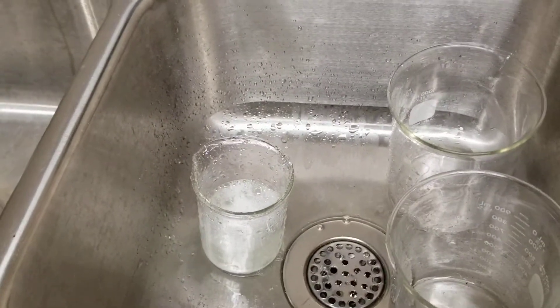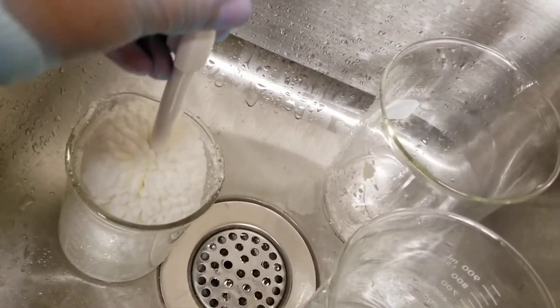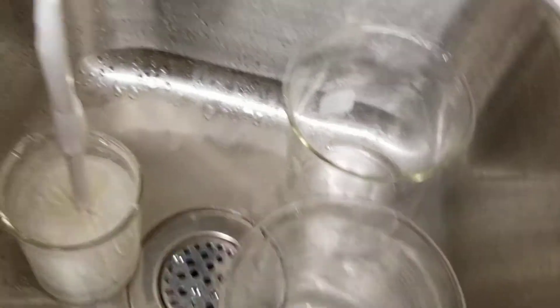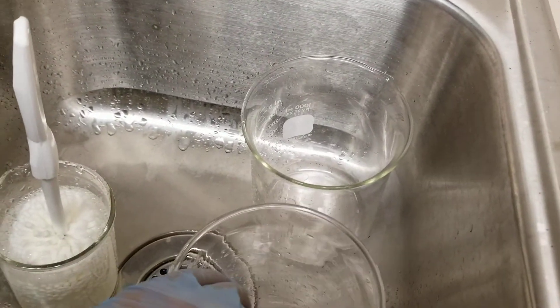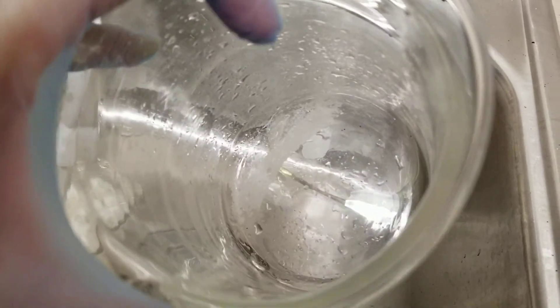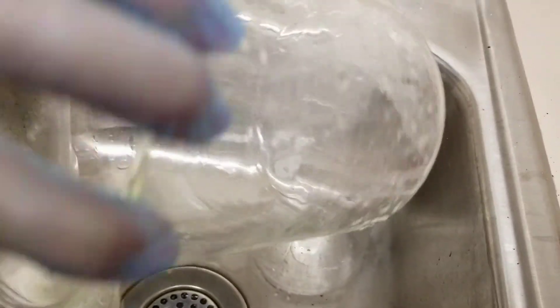Make sure the water gets warm and you would end up putting it into the beaker. You get a scrubby from the side here. Those are the test tube scrubbies. We have a couple of scrubbies here, so I like this one for the big items here. So you would go and scrub that down. I'm not going to do that on camera. And at the very end what you would do is rinse it out with the tap water and then you would rinse it out completely and thoroughly with DI water. That doesn't mean you fill it up entirely with DI water. All you do is just spray the outsides and make sure that all of the contents goes and gets the inside of those walls and the bottom and then you pour it out.